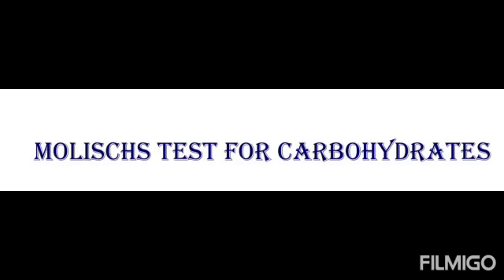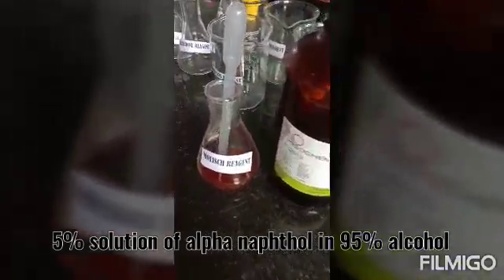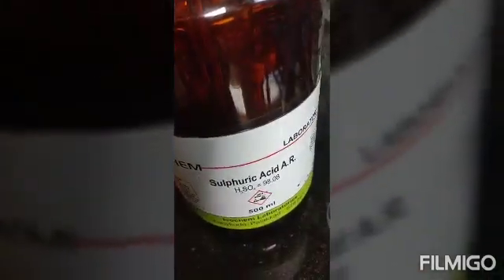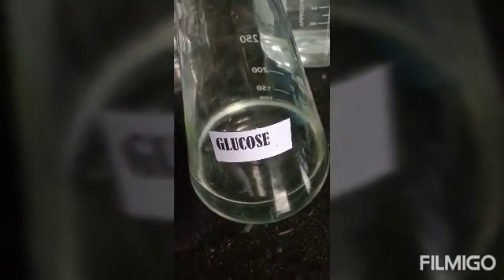Molisch test detects carbohydrates. The Molisch reagent is a 5% solution of alpha naphthol in 95% alcohol. Additionally, we need concentrated sulfuric acid and a carbohydrate — here we have taken glucose as a 1% solution.